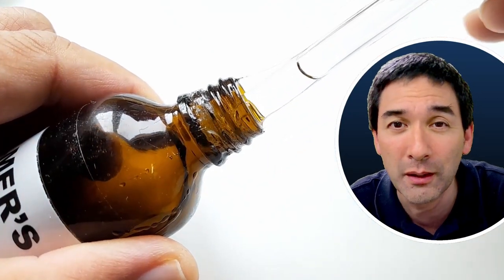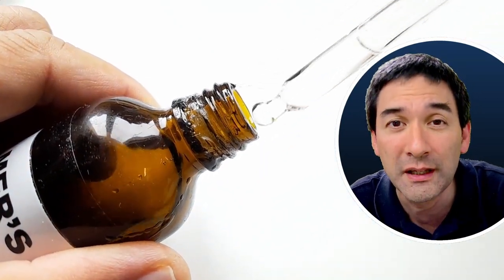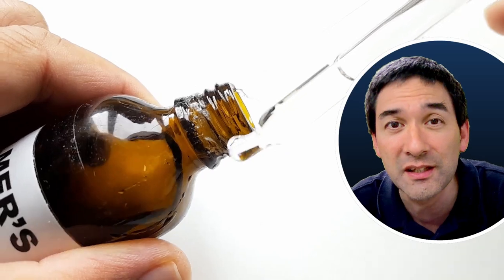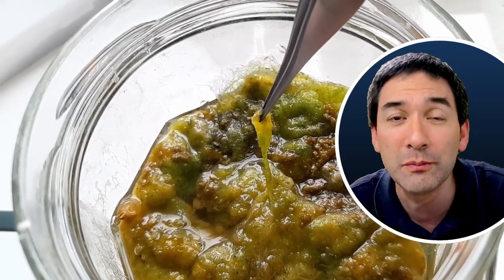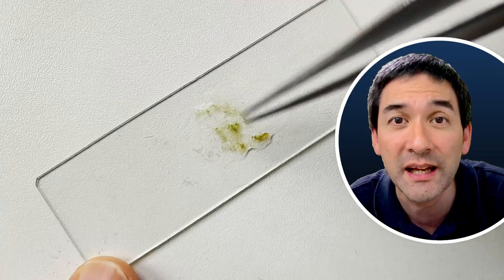I carefully mixed it to prevent bubbles from forming. I let it stand for a few days so that the bubbles could escape, and then I used this as a mounting medium to make some permanently mounted slides of some algae.